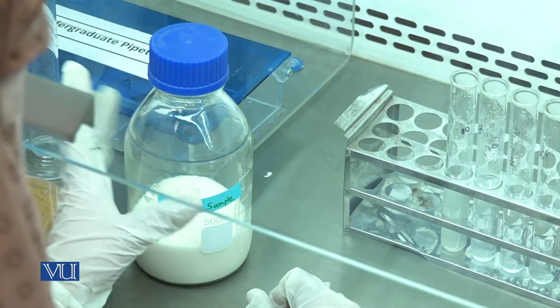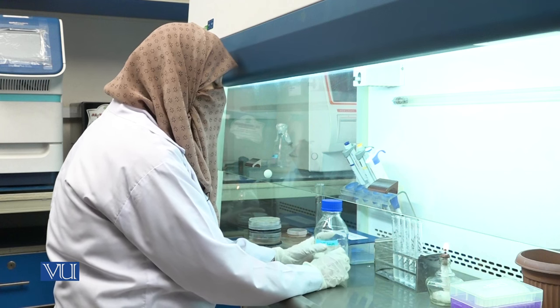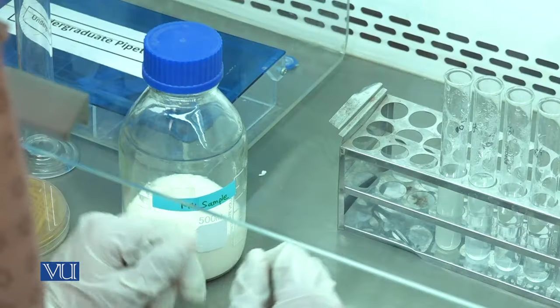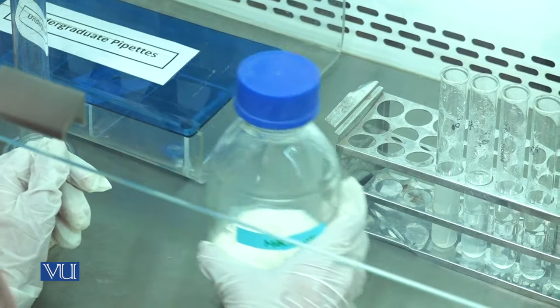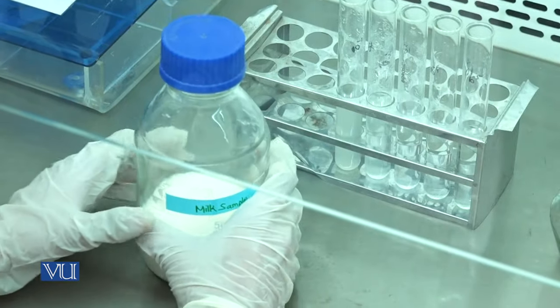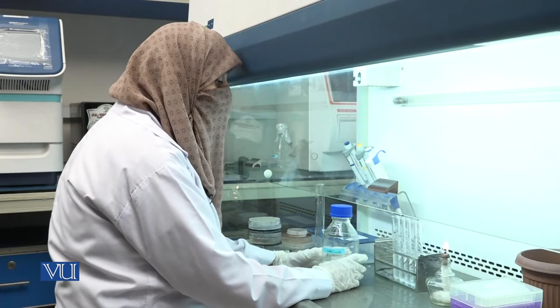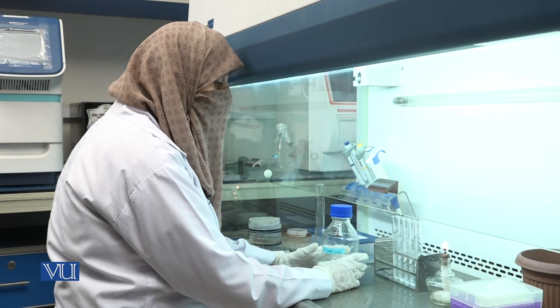Collect milk sample from cow and pasteurize at 85 degrees centigrade for 30 minutes. After pasteurization, cool the milk sample to 37 degrees centigrade.